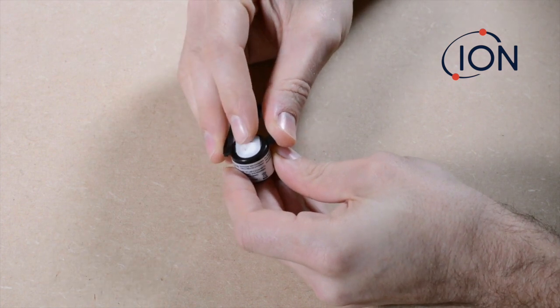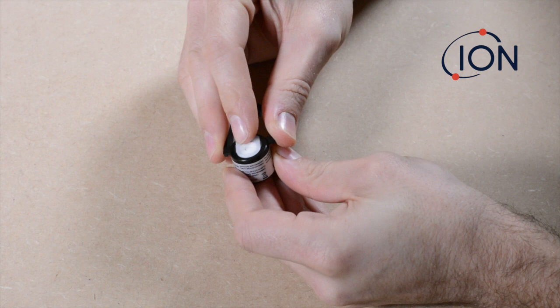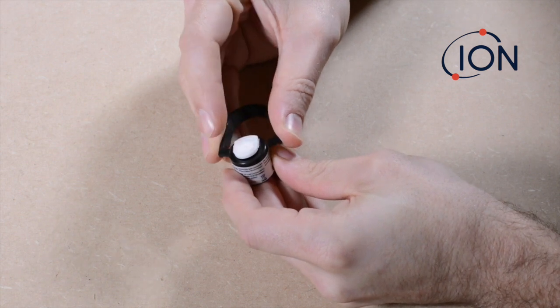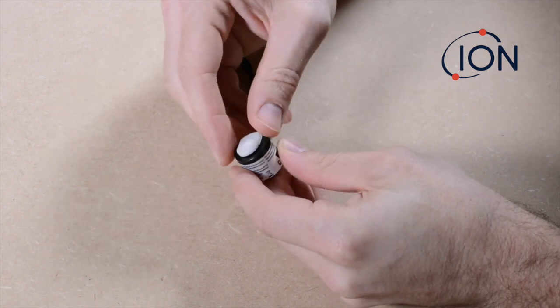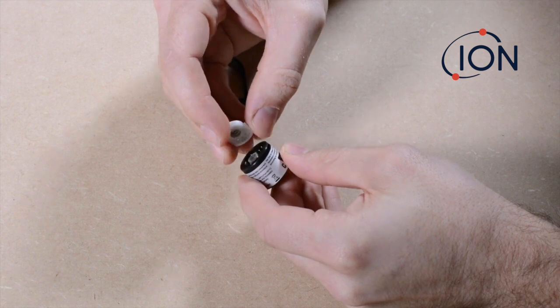Place a finger lightly above the electrode stack to prevent it becoming lost when the clip is released, and squeeze together the removal tool. The electrode stack should now spring free.